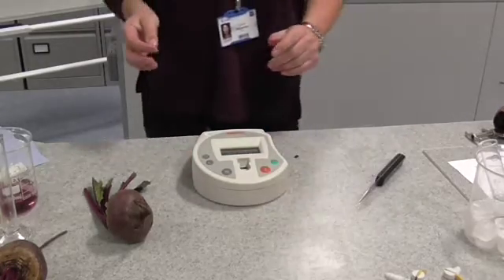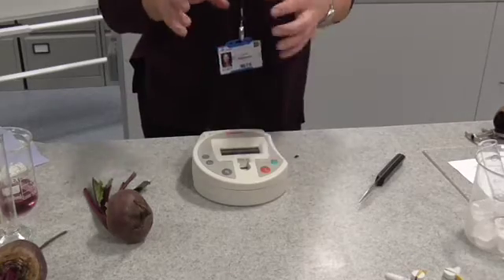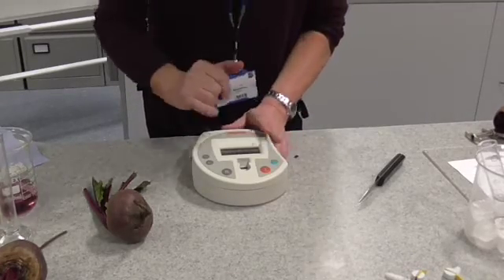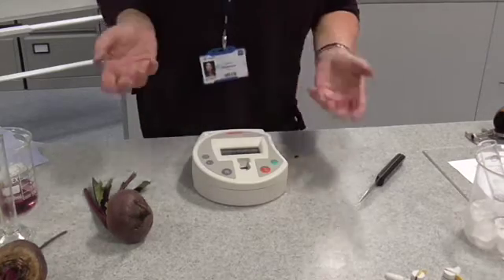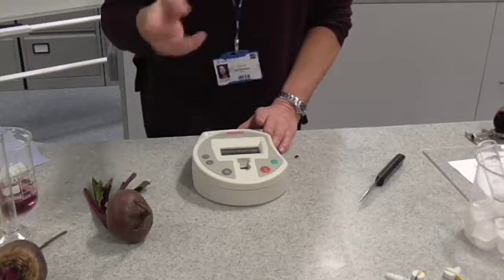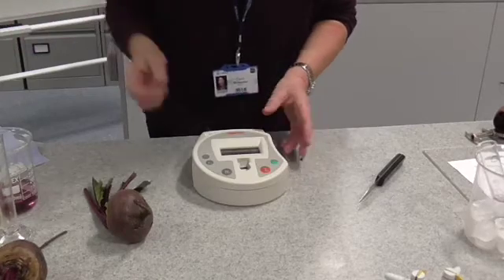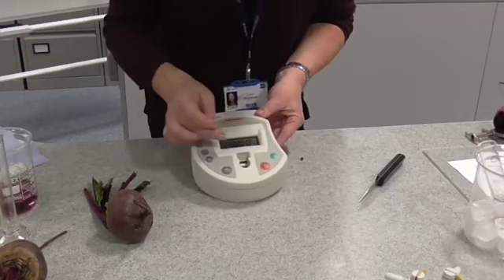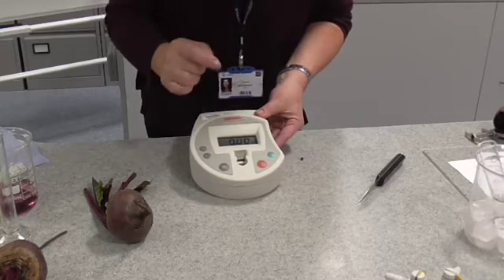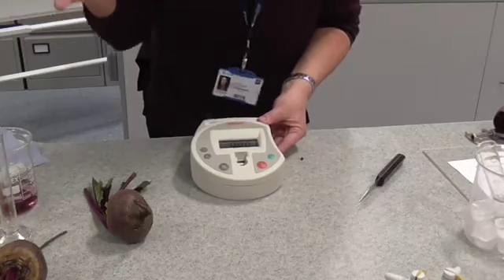A colorimeter is a device that measures the amount of coloured compound in a solution. It shines a light — and you can choose the colour — through a solution, and works out how much of the light is either absorbed or transmitted. Because we're using a purpley-red pigment, we're actually going to shine a green light through it. I've set this at the green filter, and we're going to see how much green light is absorbed by the water kept at each different temperature.